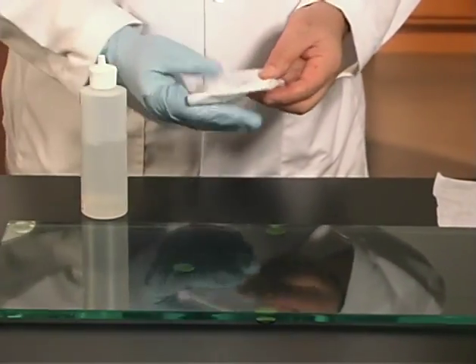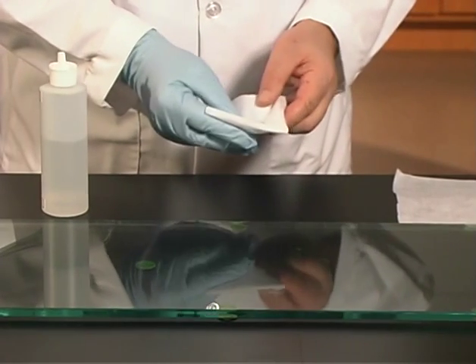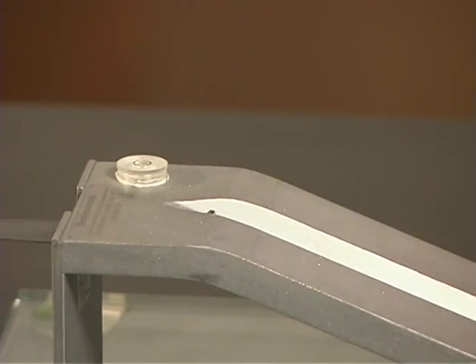Clean the stainless steel ball before each test and place it above the pin on the rolling ball apparatus.